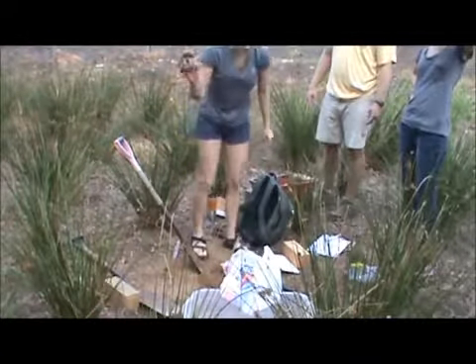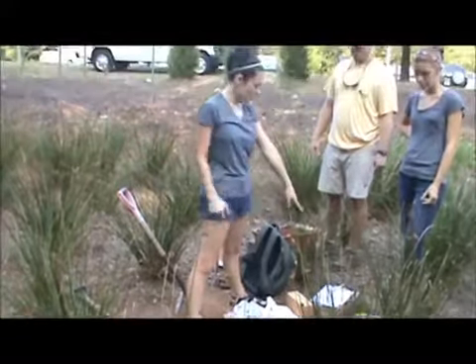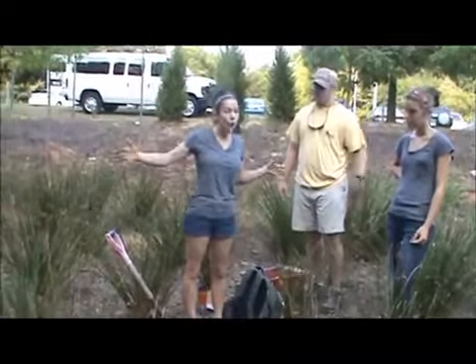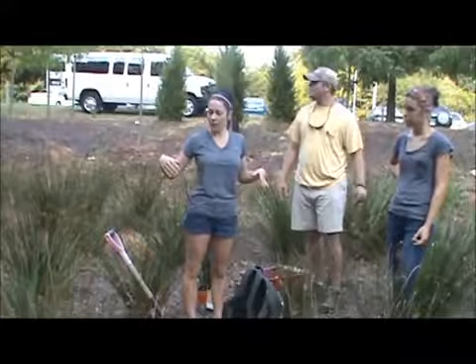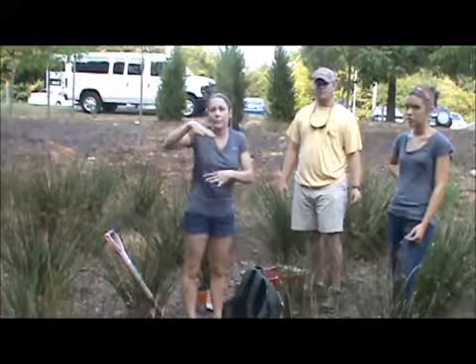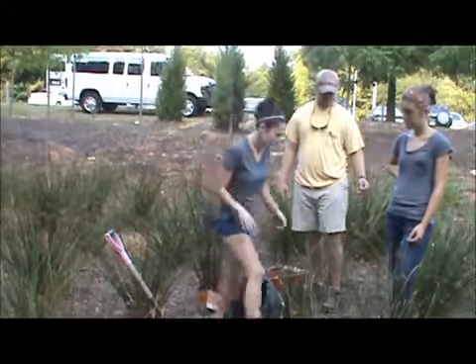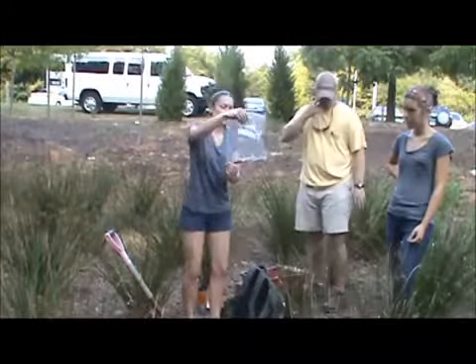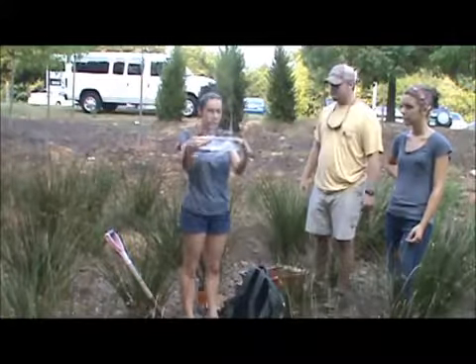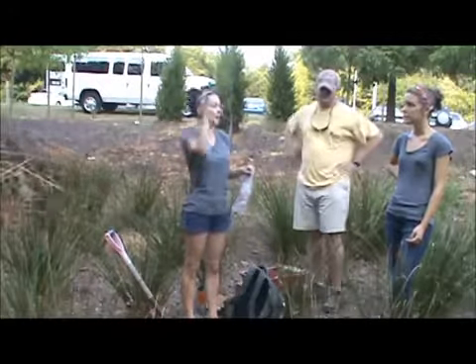You're going to do three of these, and then you're all going to take in your little Ziploc bags just a little bit of dirt. In total we're going to need around two full bags. So I figured if each group took some loose soil, throw it in here, and in the end we'll combine everybody's samples. We'll use that for a later lab.